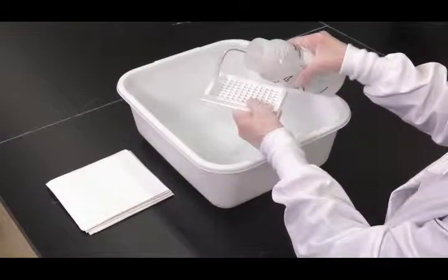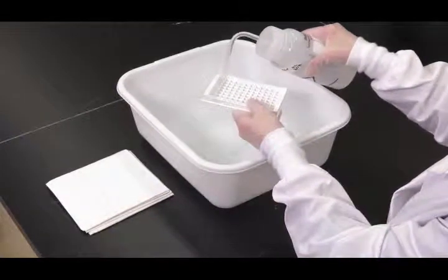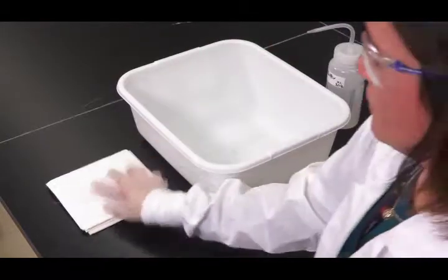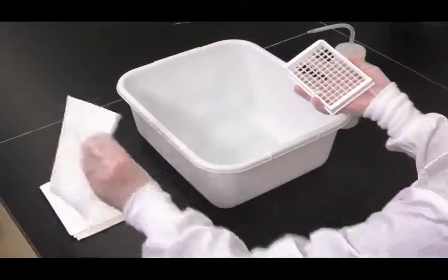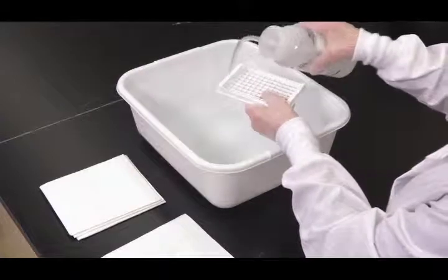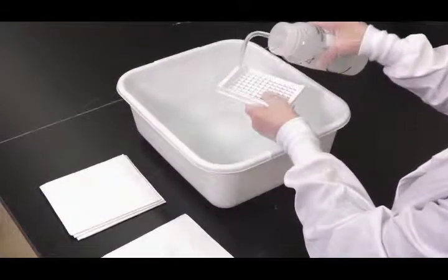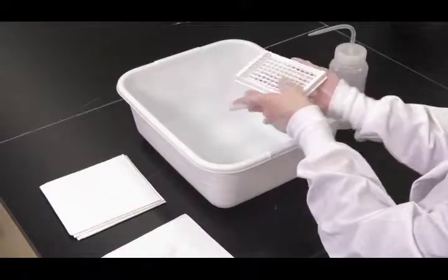Repeat to complete a total of 4 washes with 3M Wash Solution. After incubation, aspirate the contents of the 3M ELISA wells. Fill each well completely with 3M Wash Solution and aspirate.